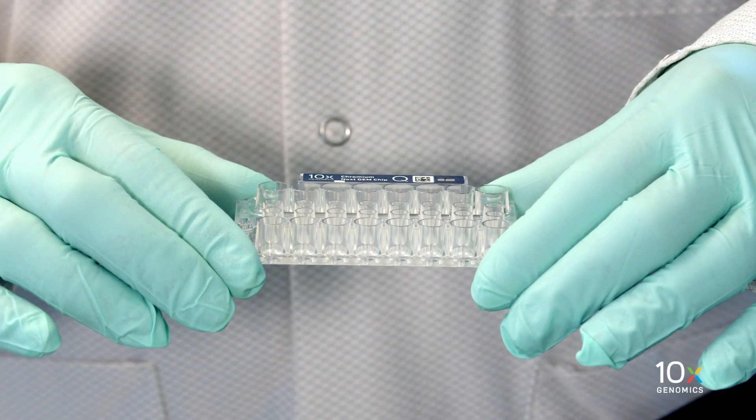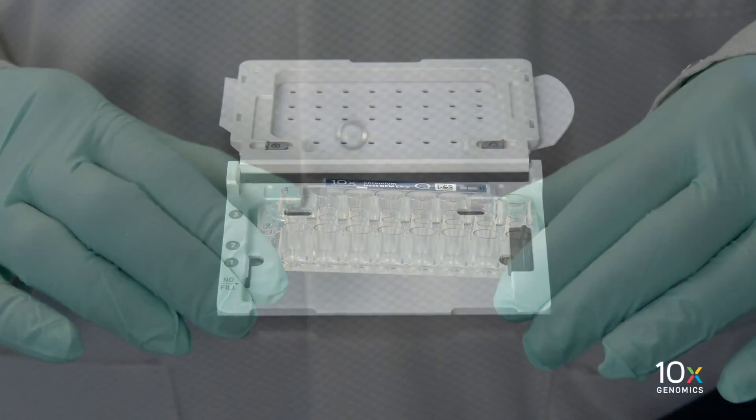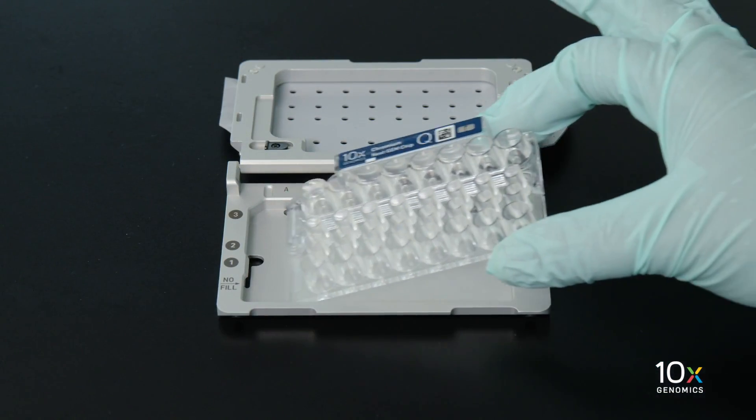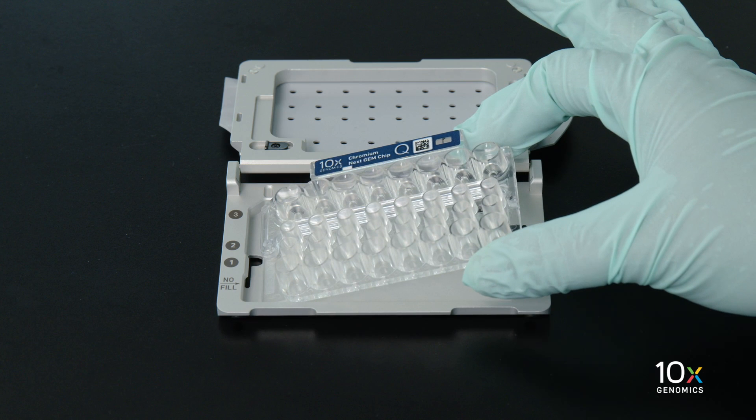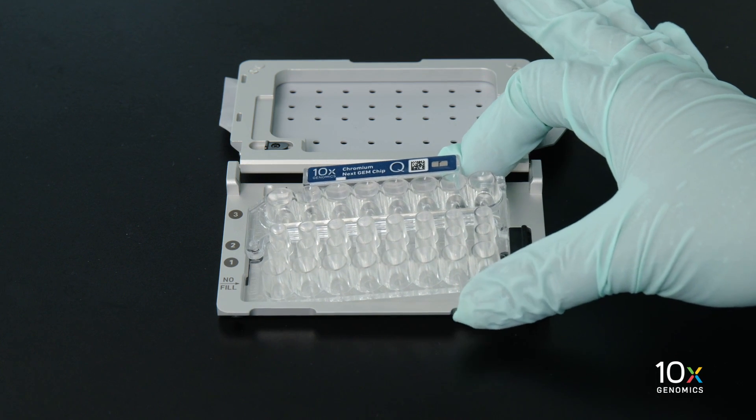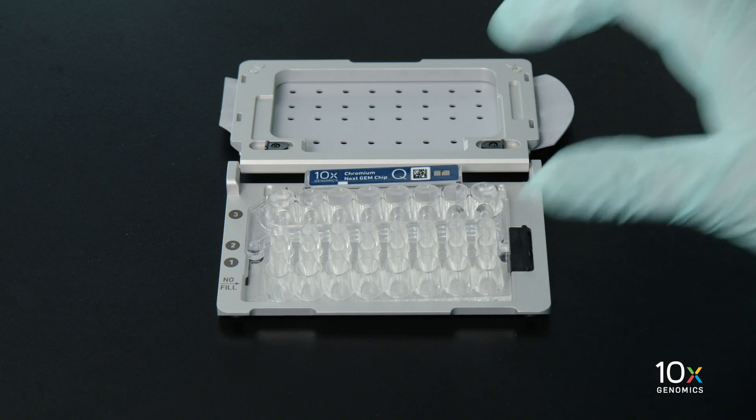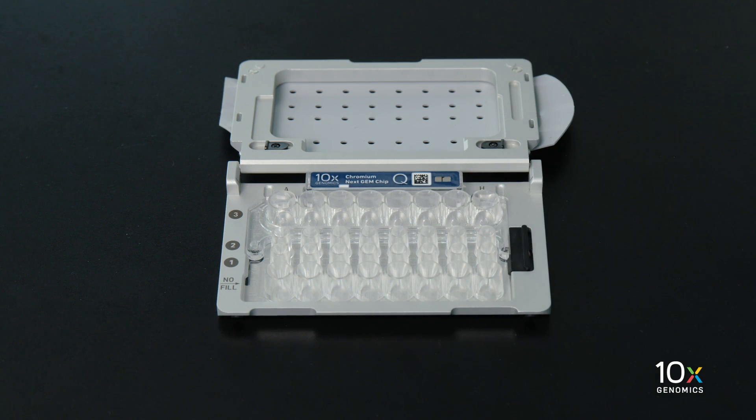We will hold the chip by the edges, making sure not to touch the bottom of the chip. Align the notch on the chip in the upper left corner and the holder. Slide the chip to the left until the chip is inserted under the guide on the holder. Depress the right hand side of the chip until the spring loaded clip engages.